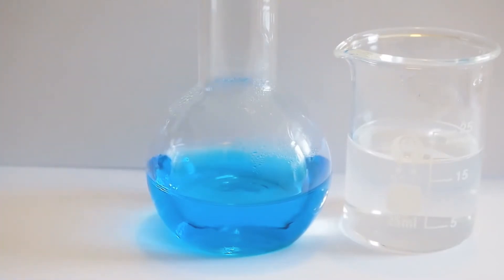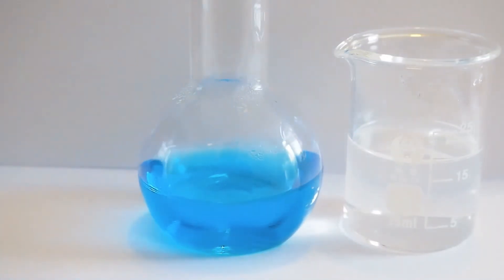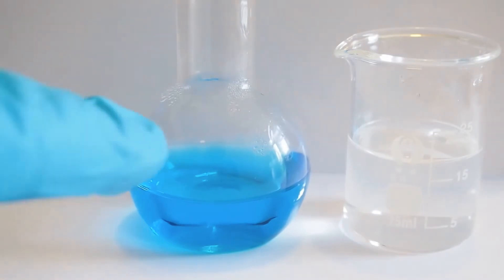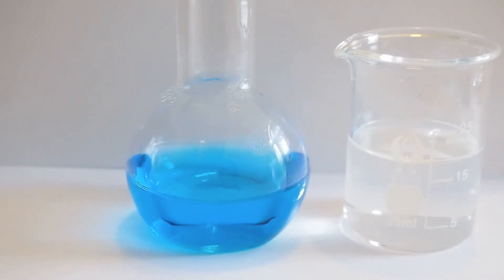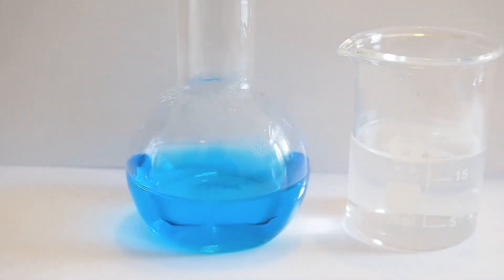This is copper sulphate. Now it should be noted that this is actually quite unpleasant to handle, and it's also quite difficult to dispose of because it's dangerous to aquatic life, so it can't go down the sink. Now I have 2.5 grams of copper sulphate dissolved in about 15 millilitres of water, and 1 gram of sodium carbonate dissolved in 20 millilitres of water.